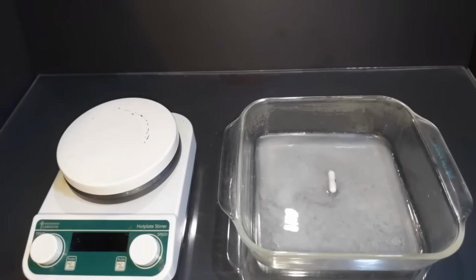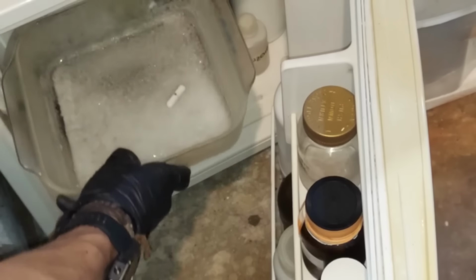Okay, there we go. All right, I'm going to put it in the fridge next, and we'll let it crystallize even more. In it goes. I'm going to leave it there overnight, let it get good and cold. About 22 hours later, it's not been a full day. Actually, this might have only taken a couple hours, but just to be sure, I left it in there longer.